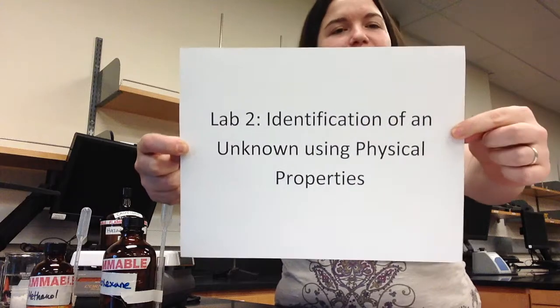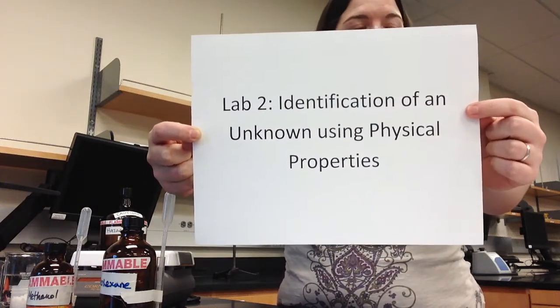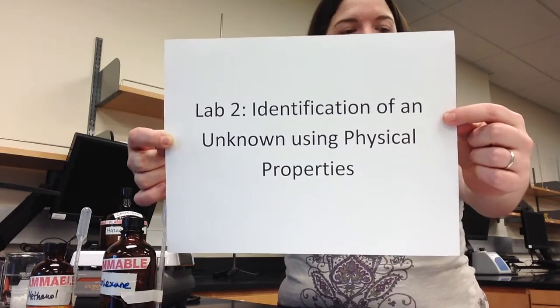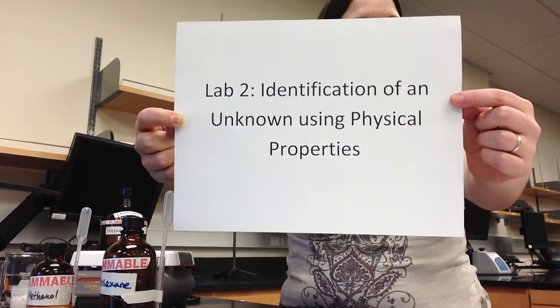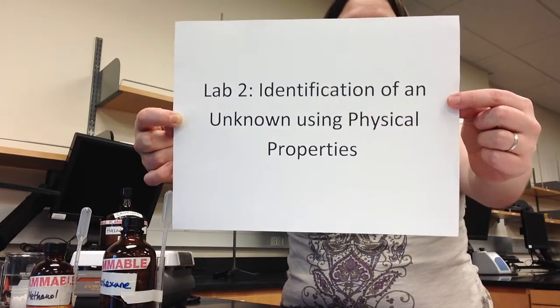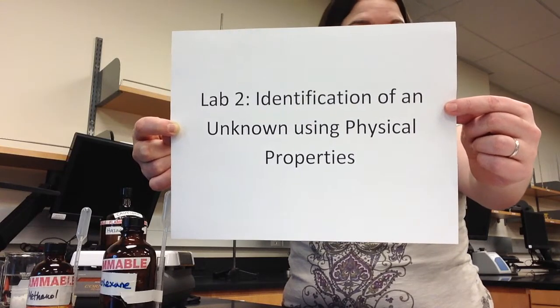Welcome to the Lab 2 Safety Information and Lab Setup. The next lab you will be completing is called the Identification of an Unknown Solid and Liquid Using Physical Properties. Physical properties are the properties of a substance that can be measured without changing the identity of that substance. Every substance has different chemical and physical properties, and these properties can be used to identify that substance.